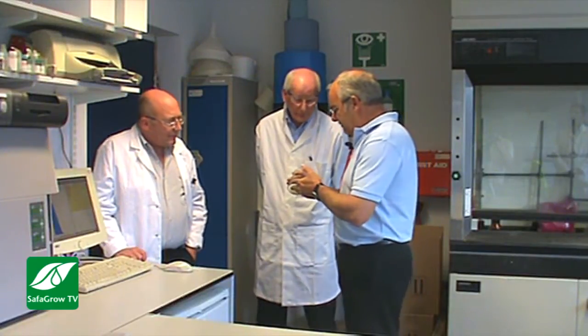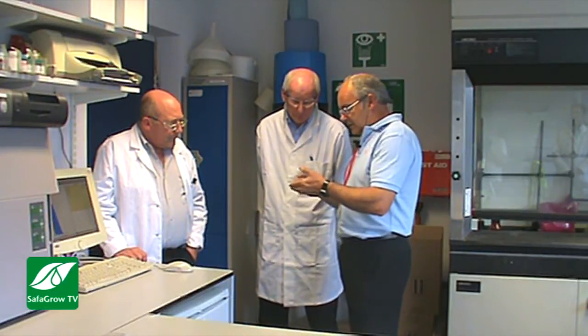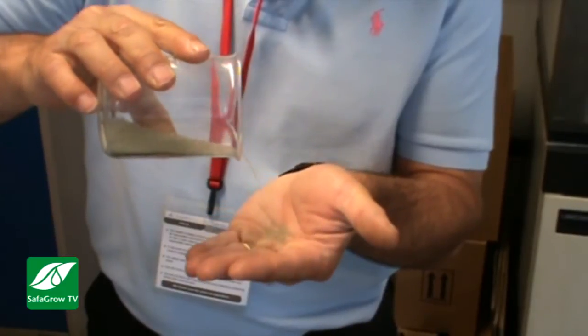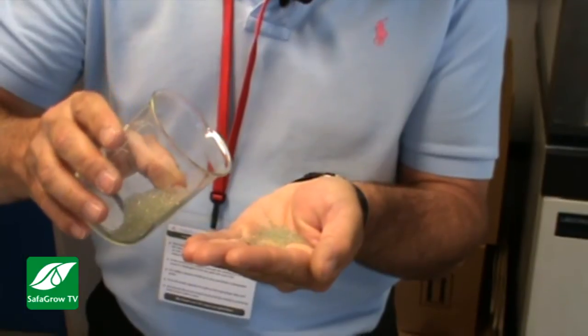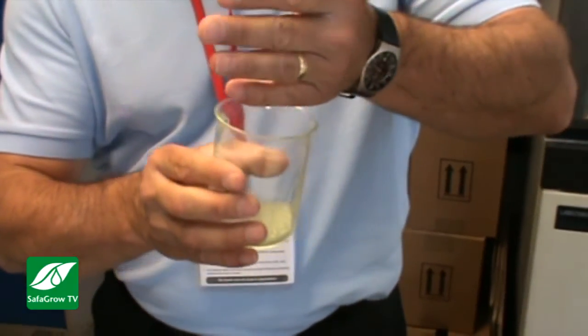John, part of what we'll see later, I guess, because you've offered us a trip round to have a look at some of the machinery. Here is a beaker of what looks to me to be fairly coarse sugar or glass balls, very tiny glass balls. Yeah, they are soda glass beads. They are nominally 1.5 millimetre in diameter. And they go into our mills, and we'll see those a bit later.